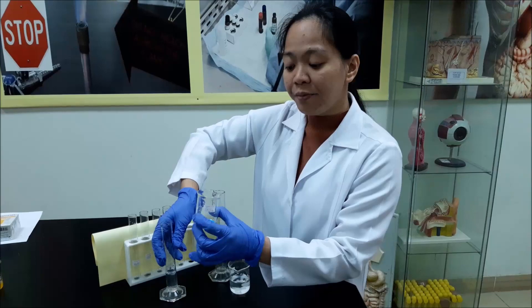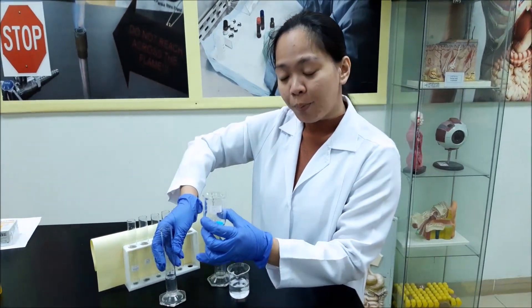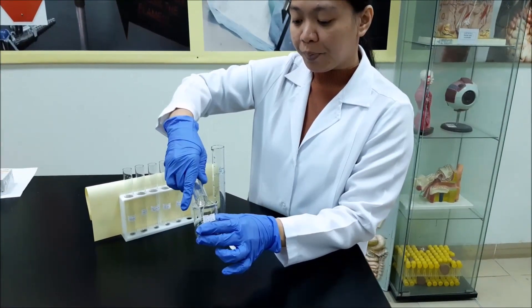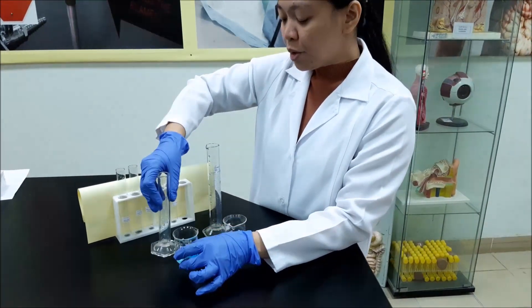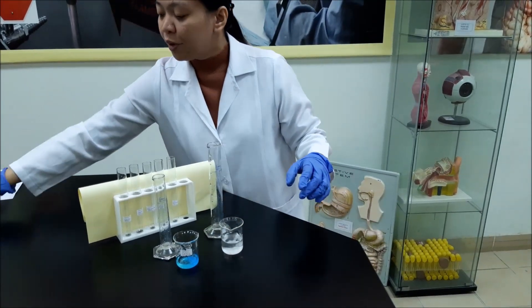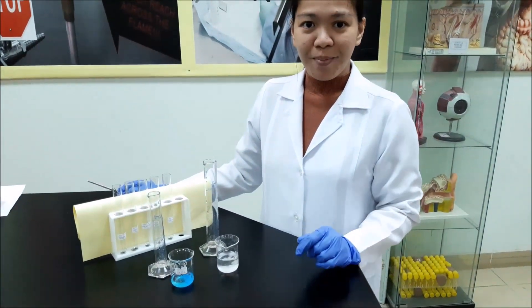On the other hand, we have 1 gram of copper sulfate and 10 ml of water. So this is the solution that we are going to use for the experiment.